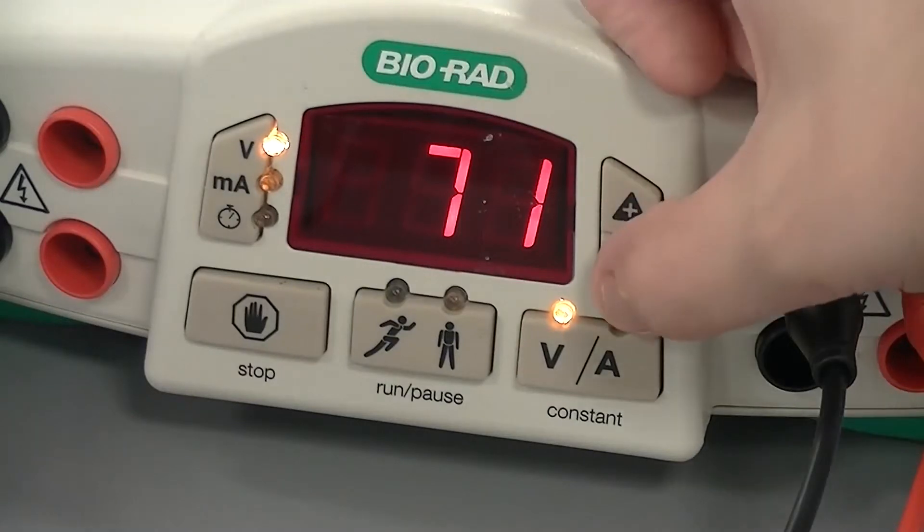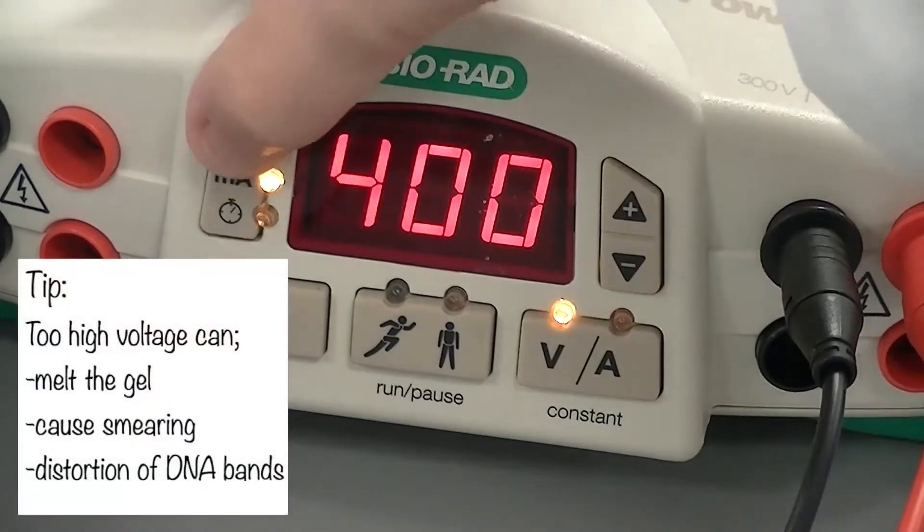However, this can cause problems. When everything is set, press the run button.